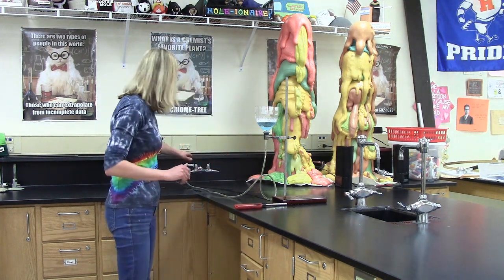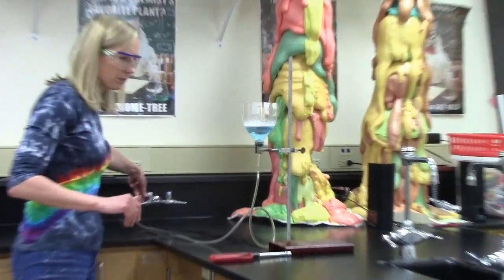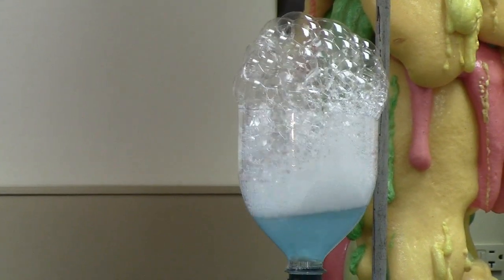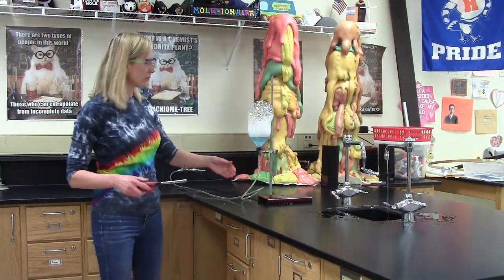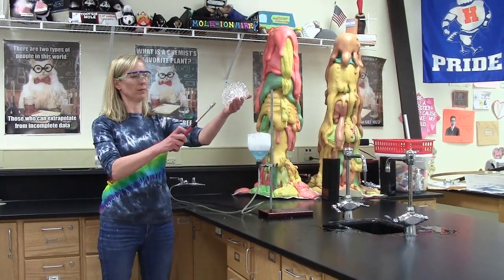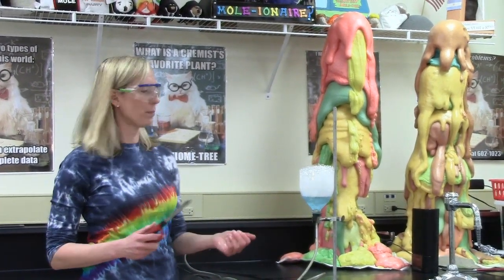Okay, so here we go. I'm going to slowly start creating some bubbles. Move this around just a little bit. Here we go. Slow it down a little bit because that looks crazy. Okay, so let's see if I can get my hand extremely wet. Lift off a couple of these bubbles for you. Woo, that's hot. Let's see if we can do that a couple more times.